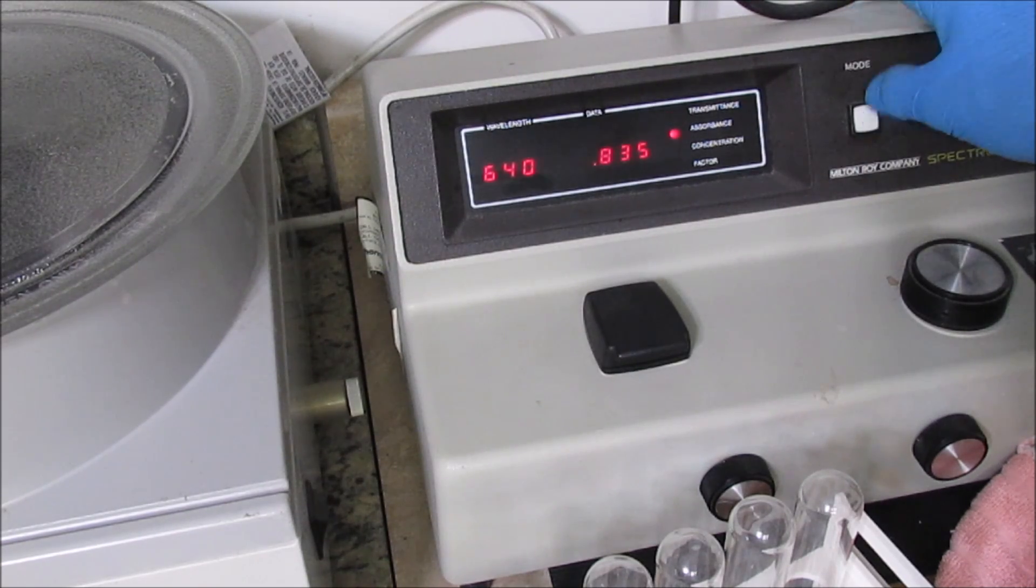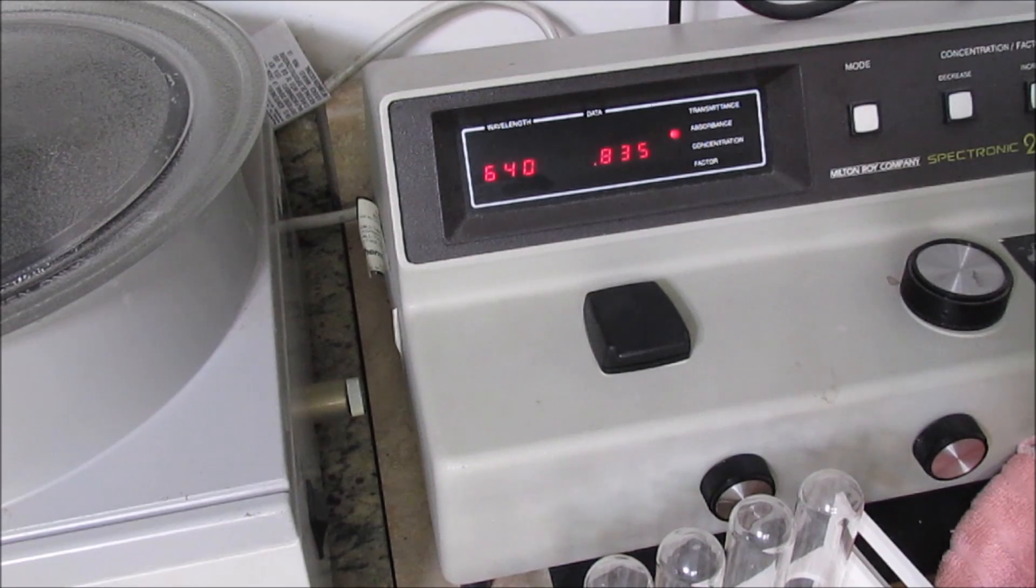Shift the mode to absorbance here, and I get 0.835.